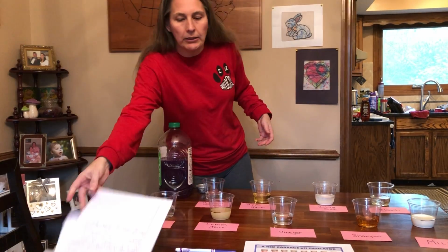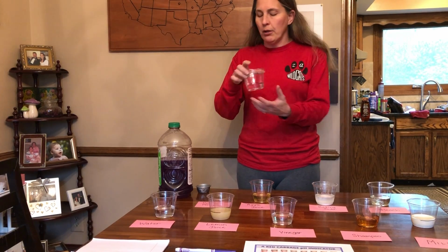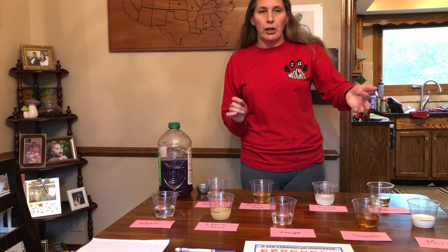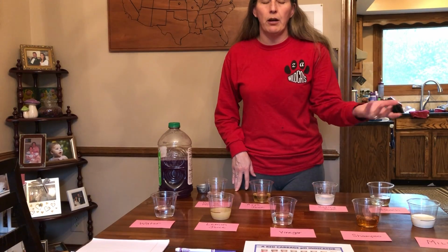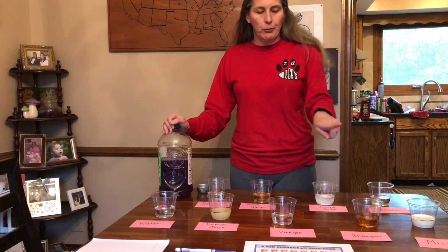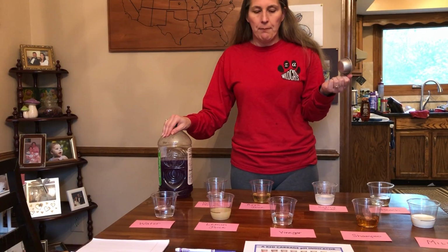So we've got some common things, just some information about how we set this up. We did draw little black lines on the cups so that all of the amounts are the same. Remember, we have to keep that constant. We also tried to use things that are very neutral in color because like for shampoo, if I had used strawberry red shampoo and one of the colors that I'm looking for is red, then obviously the color of the material is going to kind of offset the indicator color. So you want to use things that are kind of neutral, whites, clears. A few of them are slightly yellow, but I think that we'll still get a pretty good reaction. Another thing is we're going to use exactly the same amount of indicator with each one. Have to keep that constant.